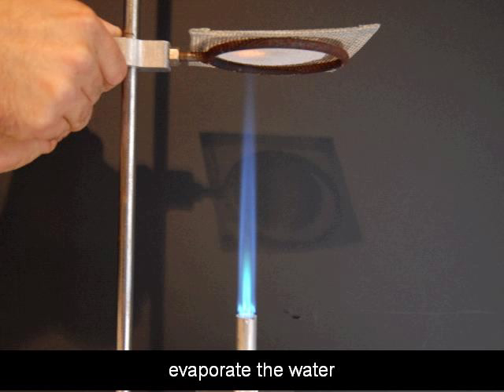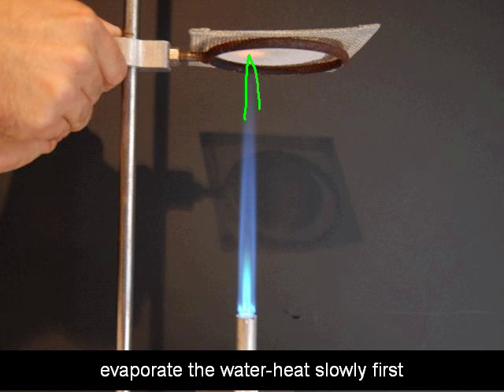And you'll be using your Bunsen burner. What I like to do is go ahead and get the iron ring height above the Bunsen burner adjusted first. The butane Bunsen burners that I use, they are best operated when they're on maximum flow rate. So I just turn the nozzle on and adjust the heat by raising and lowering the iron ring. You always want to start out by heating something slowly. So I set up the iron ring and the wire gauze so the tip of the Bunsen burner flame just touches that wire gauze. And maybe you didn't know this, but the darker blue section of the flame, all of this through here, that's the hottest part of the flame. This lighter blue section inside right there and along the edges, that's actually the cooler portion of the flame.